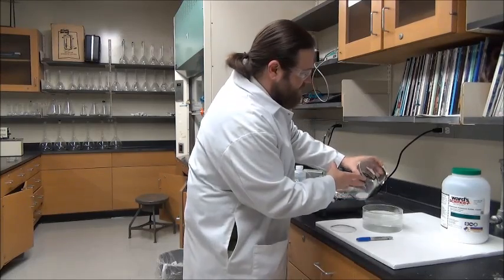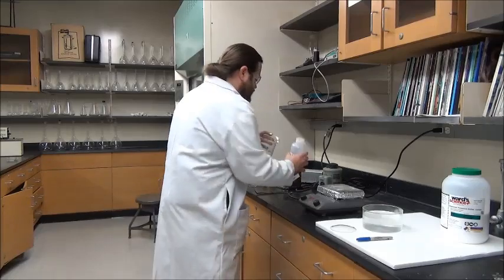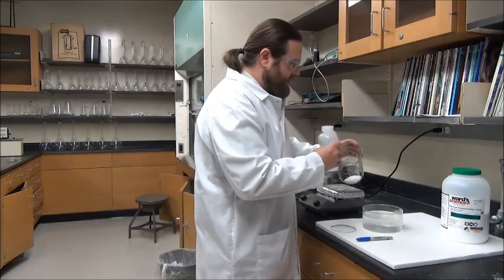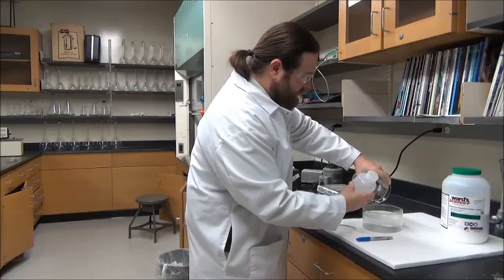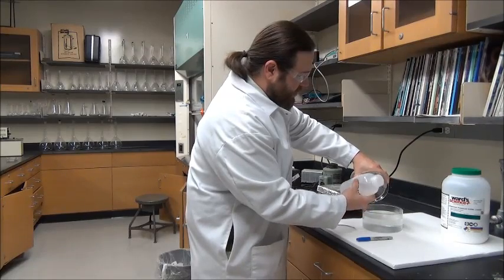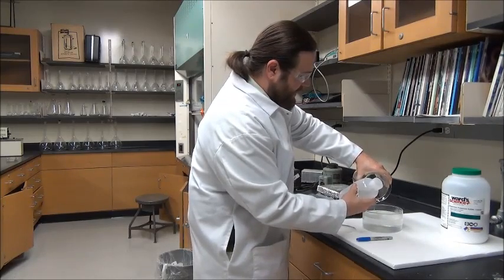Because this is a competition, you want to make sure that you got all that alum in there, so it doesn't hurt to squirt in a few extra milliliters of water to really rinse things off and make sure you get every last little bit of alum out of there.